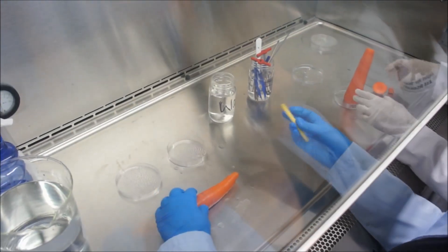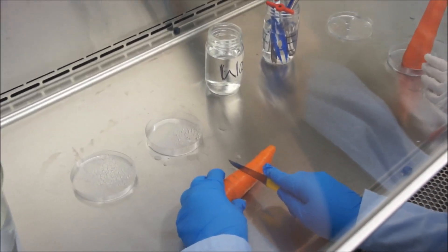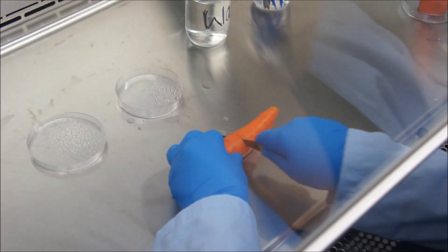If the center section is longer than the cork borer, break this section in half so each section is no more than 7 cm long.